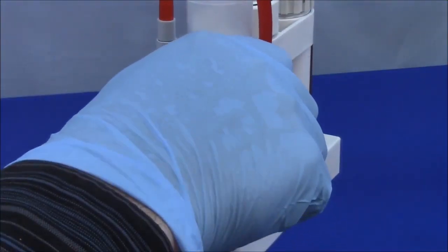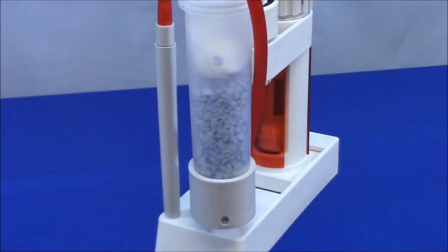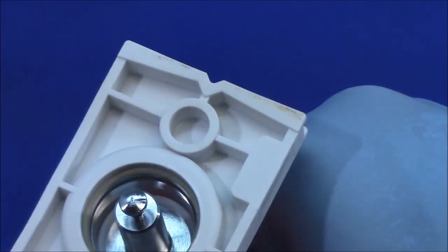Sodium hydroxide titrant must be protected from atmospheric carbon dioxide, so the drying tube is filled with a CO2 scrubber and fitted on the burette stand with the drying tube holder. The burette body houses the plug-and-play RFID. Burette volume, titrant concentration, and the serial number of the burette are kept here. So this feature prevents the accidental use of the wrong reagents.